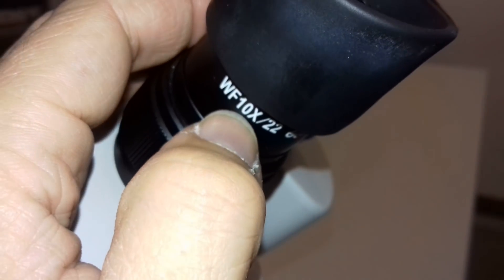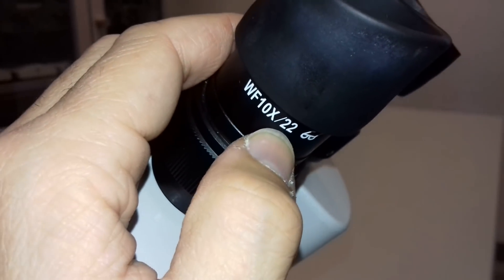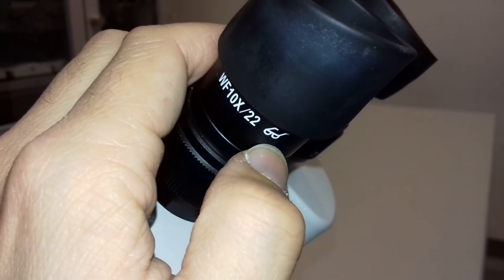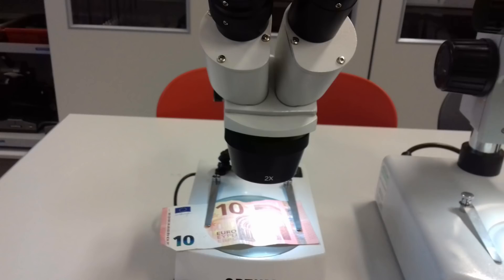Yeah, and here we look again, same magnification. It's usually a little bit more, so it's less of a tunnel view, the larger the number. So now let's have a look here.